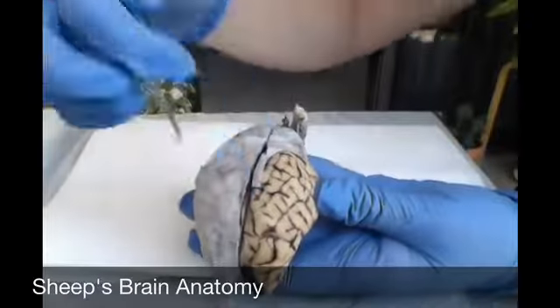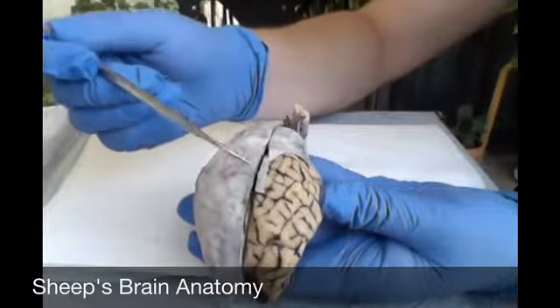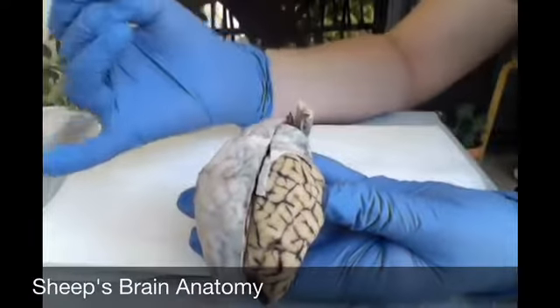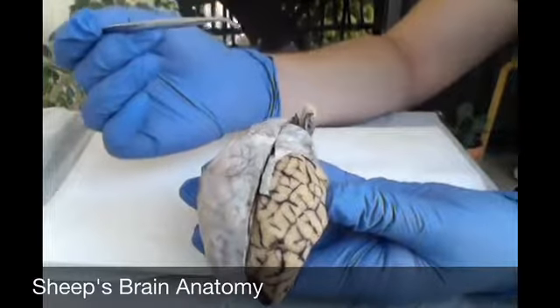And actually, when I dissected it, you can see that it's a harder texture that goes all the way down and separates both hemispheres, or kind of brings them together.